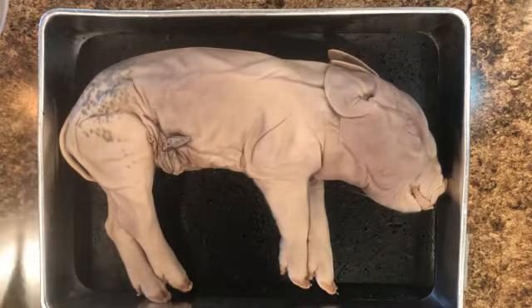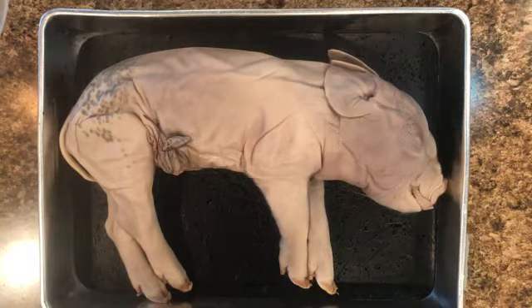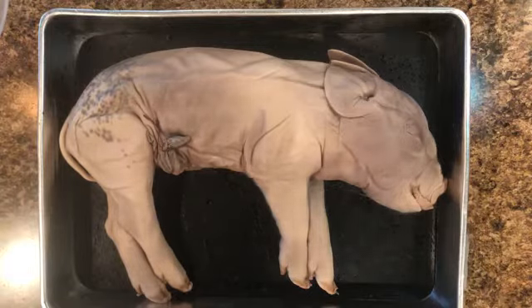Remember, our objective for this overall unit is to be able to compare and contrast how the earthworm, the frog, and the fetal pig obtain, use, transport, and excrete energy. So we have already finished the earthworm and the frog. Today we are starting with our fetal pig. A couple things I just want to go over before we actually get started.